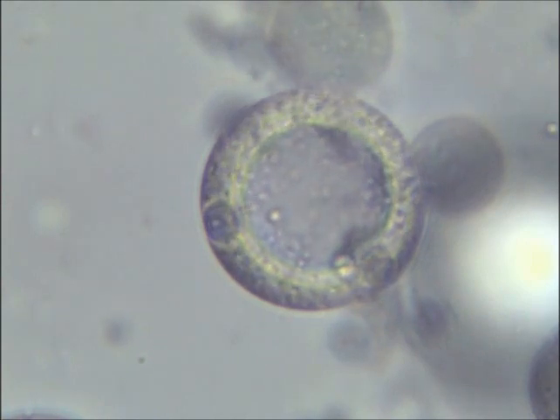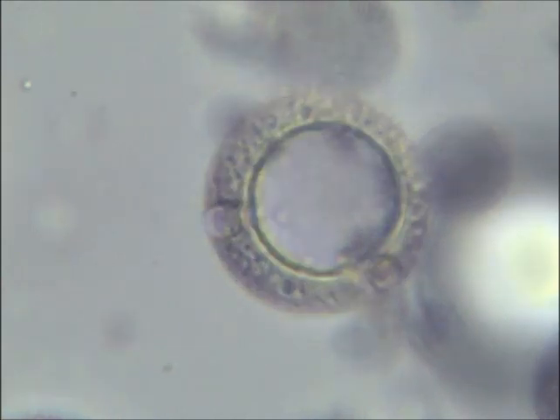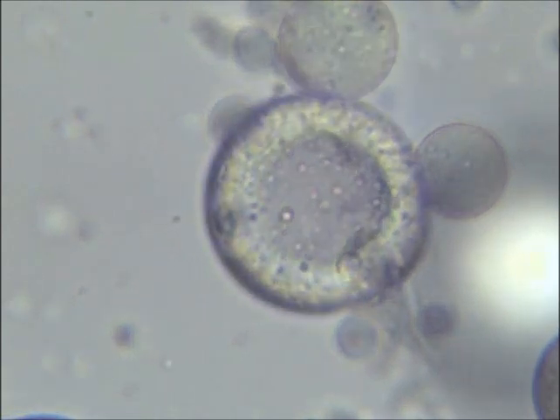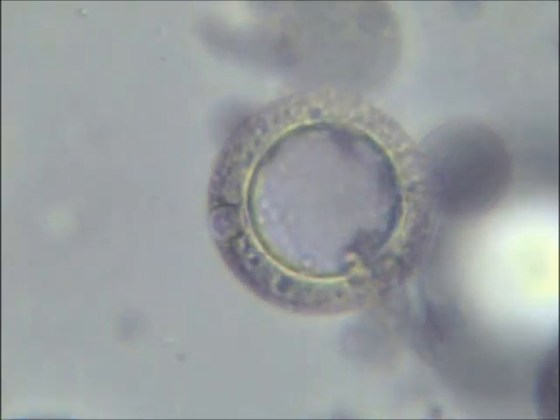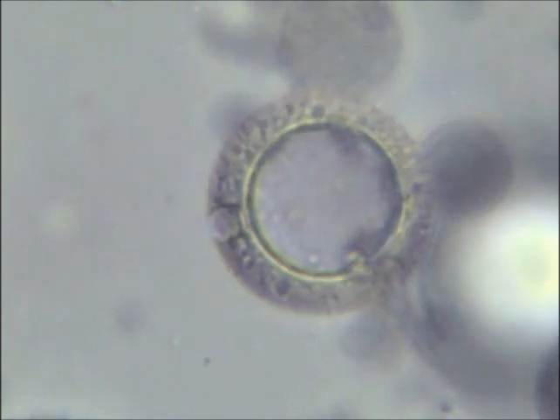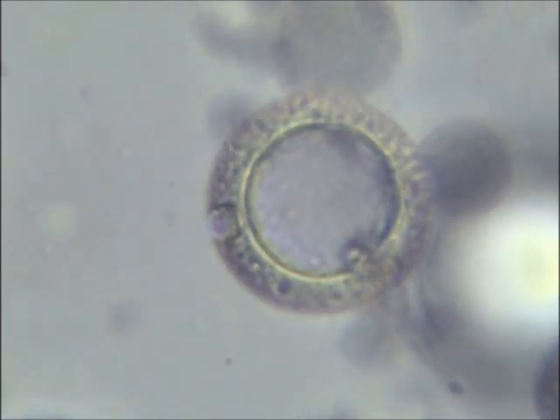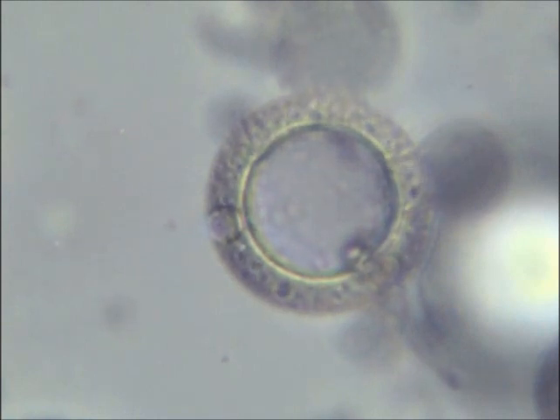This will probably be my last video of fatty acid vesicles under the microscope because if you've seen one fatty acid vesicle, you've seen them all pretty much. I have learned two things so far. First off, it is fairly easy to create fatty acid vesicles and view them under the microscope.